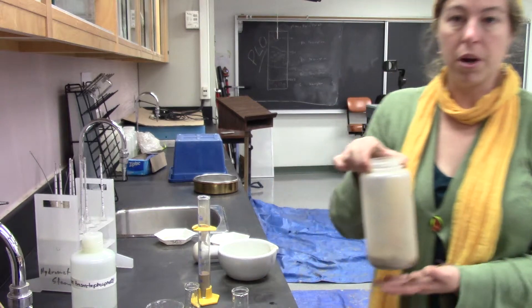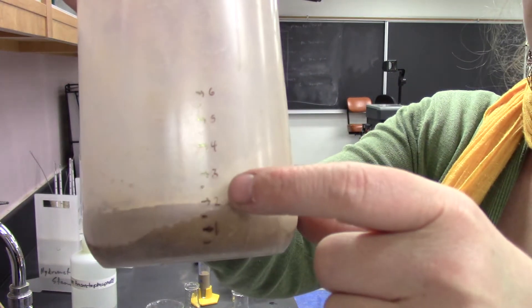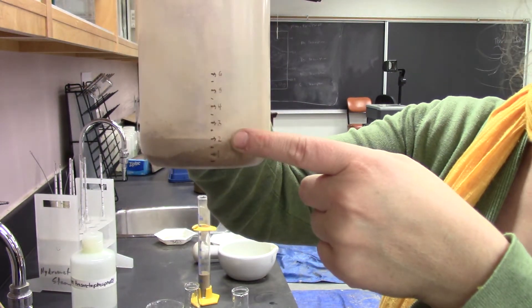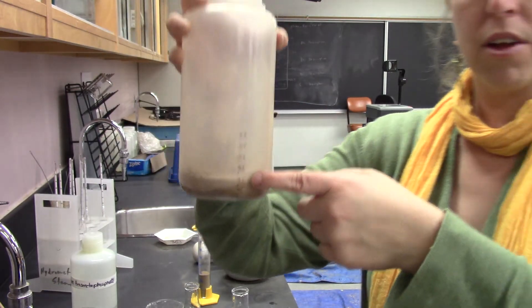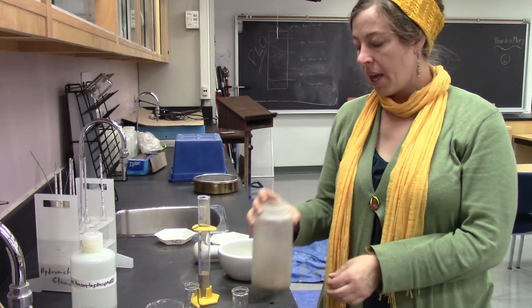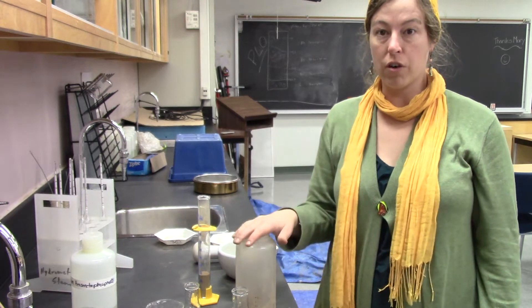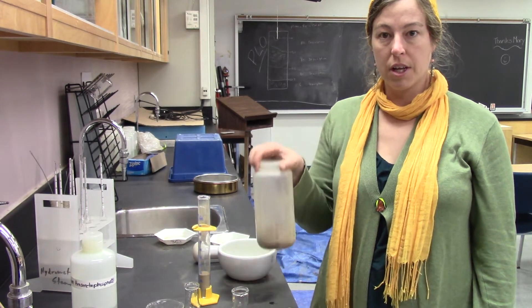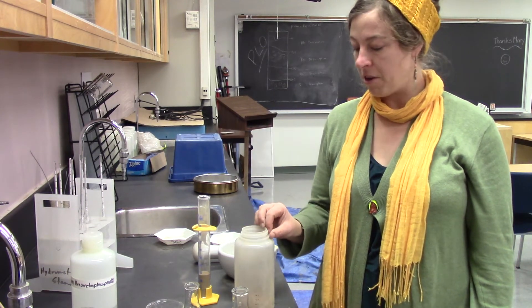This one is just a Nalgene container and I've put measurements on here. I've put soil in until I got to the two centimeter spot, and I just took a ruler to draw those on it. It took not 50 grams but almost 200 grams to get to that two centimeter spot on my measuring device.